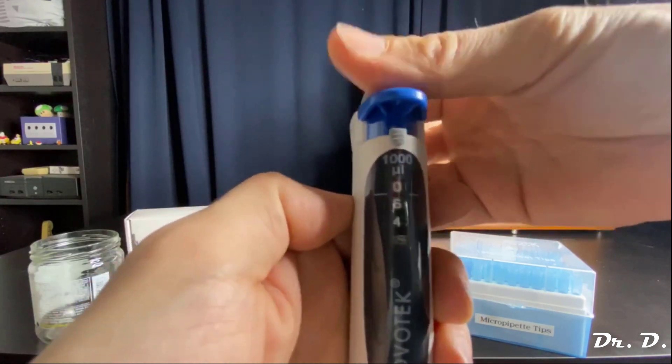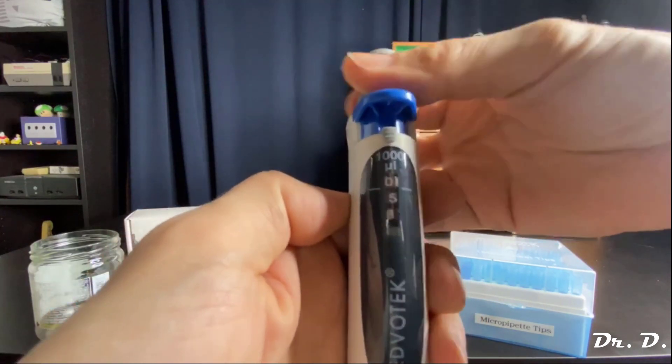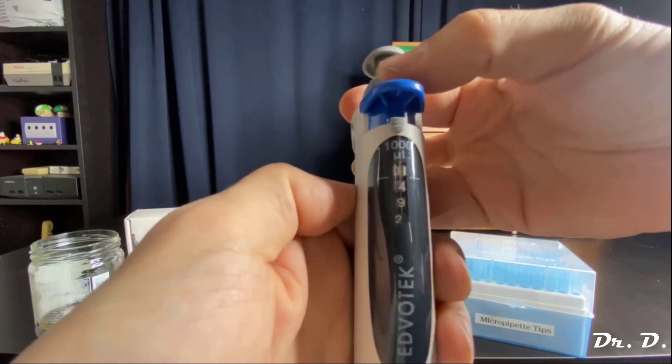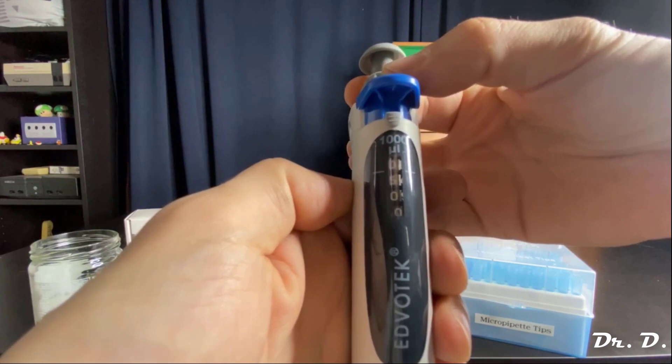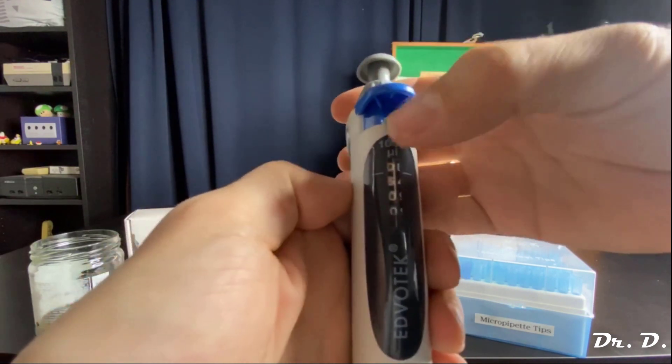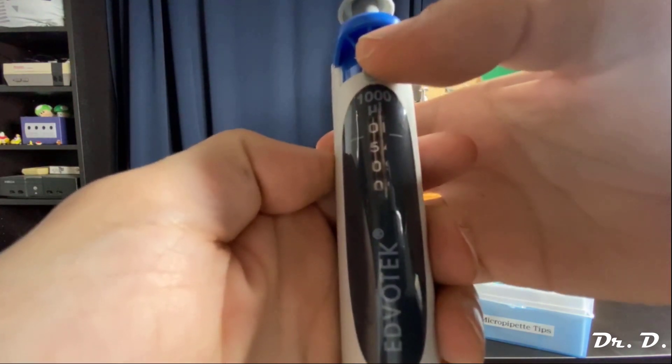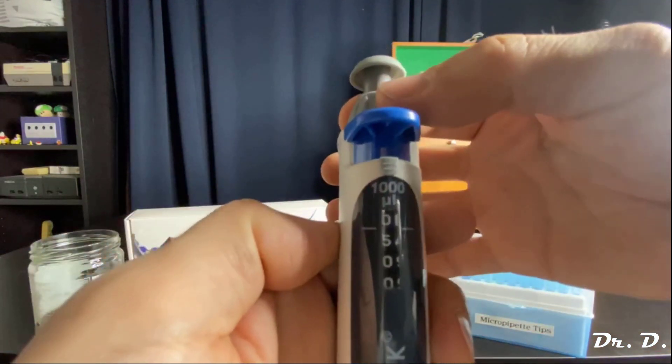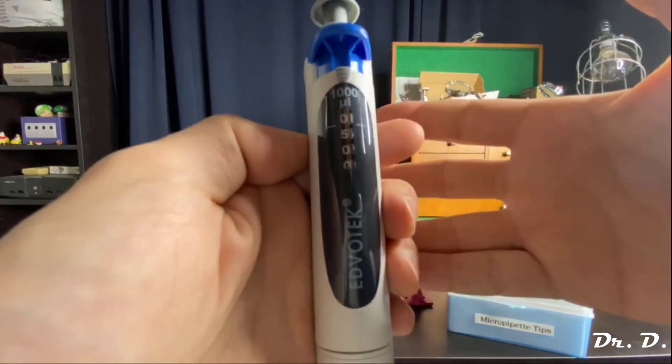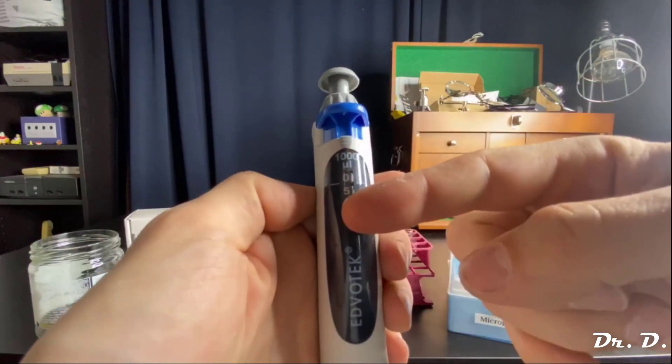And again, it will take a little while. You have to spin pretty fast. And let's get it exactly to 500 microliters. Once I'm at 500 microliters, 0500, I will lock it. See, push the tab to lock. You can see that it locked the setting in place.